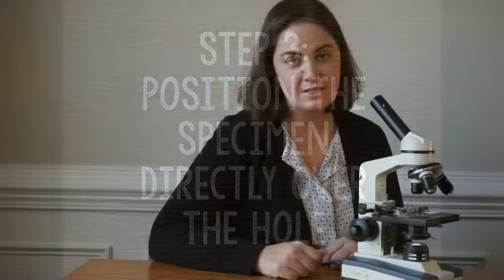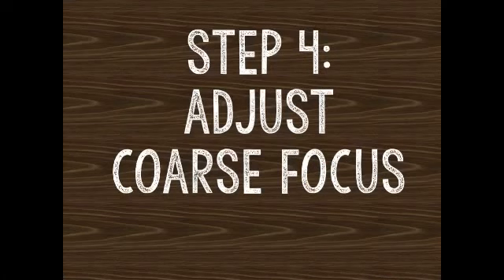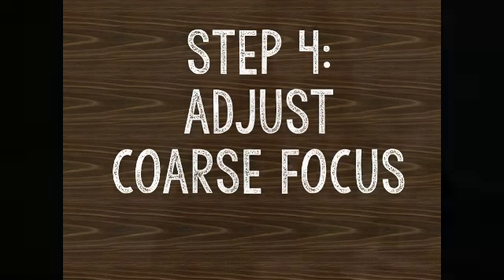Step number 3 is to position your specimen so that it's directly over the hole where the light is passing through. Step number 4 is to look into the microscope and adjust with the coarse focus knob, which is your larger one, until the specimen becomes clear. Don't go too quickly or you'll pass the point of clarity and then you'll be stuck again.